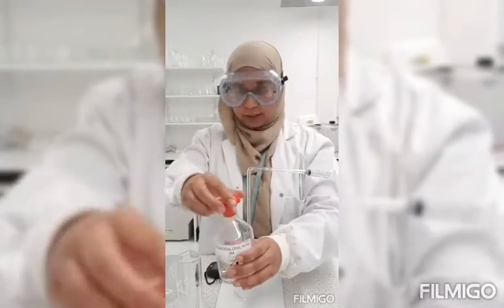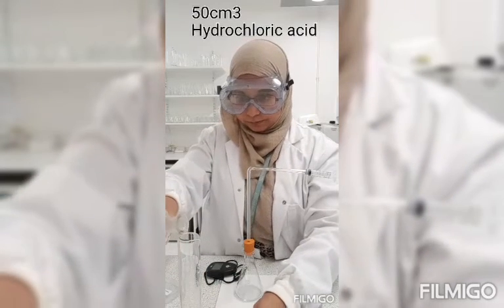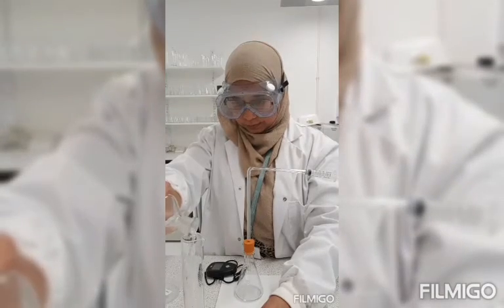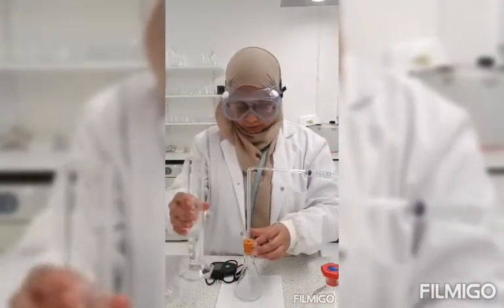Firstly, I will measure out my hydrochloric acid, and I need 50 centimeter cubes, to my conical flask.